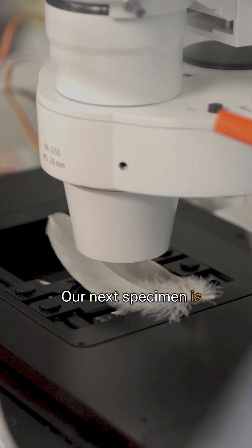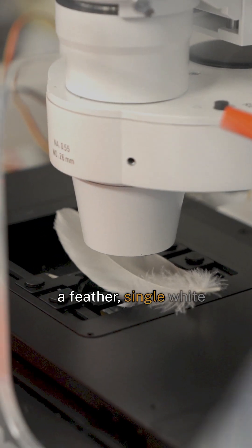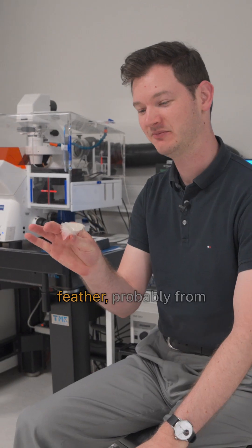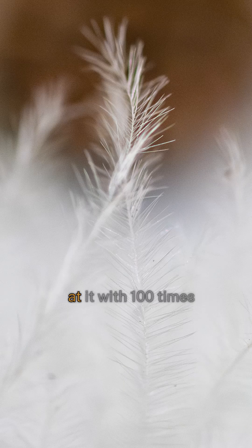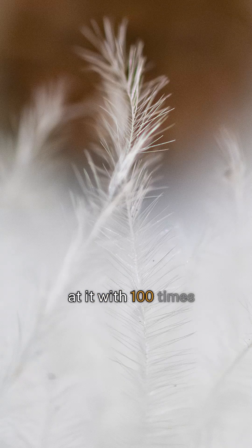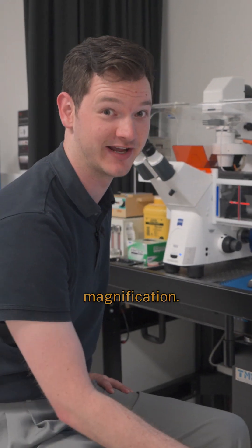Our next specimen is a single white feather, probably from a cockatoo or a corella, and we're going to look at it with 100 times magnification.